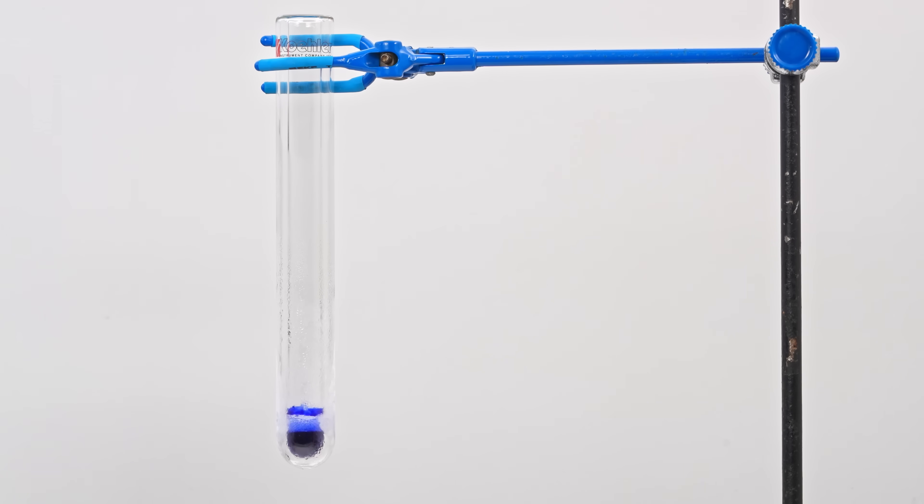Now pure liquid ozone remains in the test tube, and look, the test tube becomes pale blue because gaseous ozone is a pale blue gas.